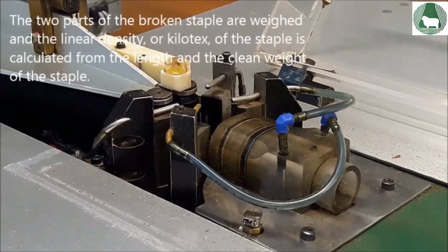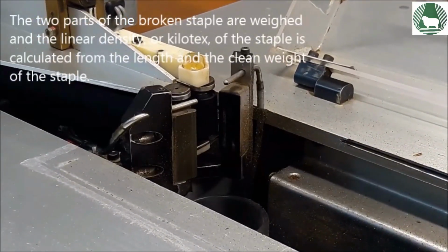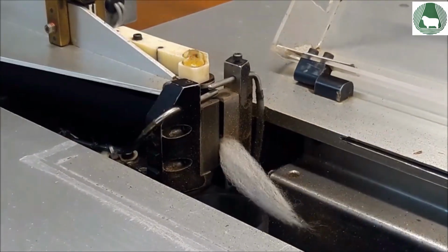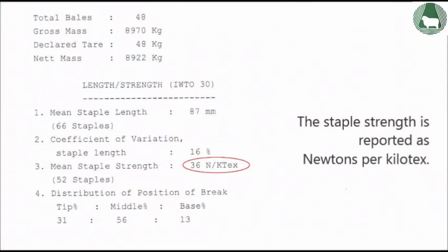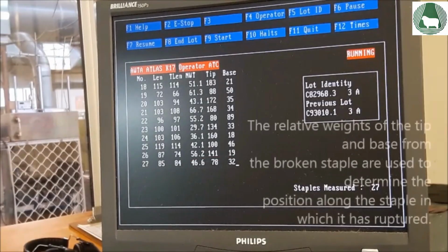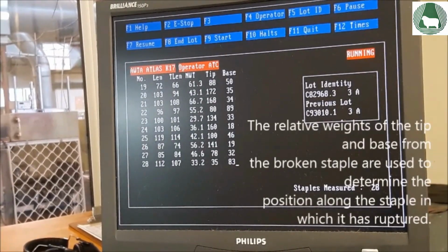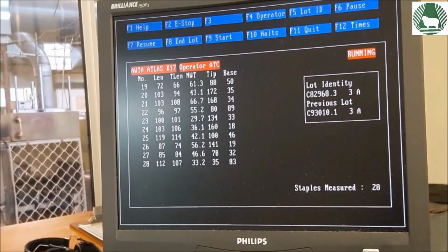The 2 parts of the broken staple are weighed, and the linear density, or kilotex, of the staple is calculated from the length and the clean weight of the staple. The staple strength is reported as newtons per kilotex. The relative weights of the tip and base from the broken staple are used to determine the position along the staple in which it has ruptured.